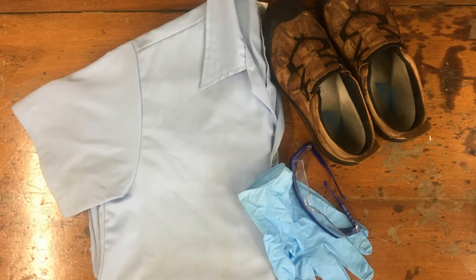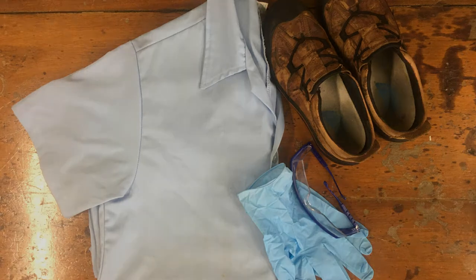Remember our safety gears when working in the lab, our lab coats, safety shoes, gloves, and of course, our goggles.